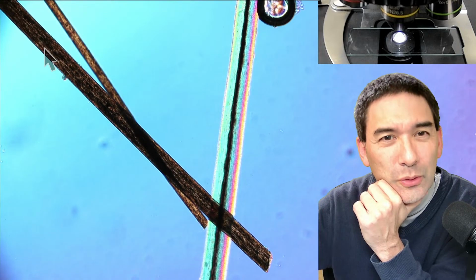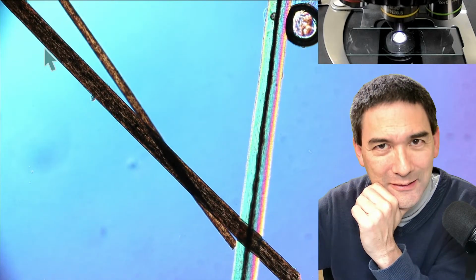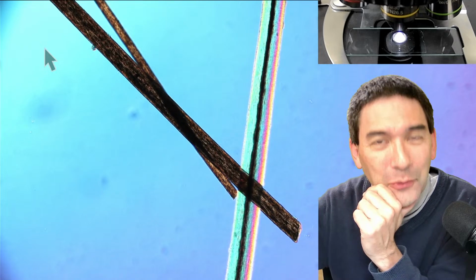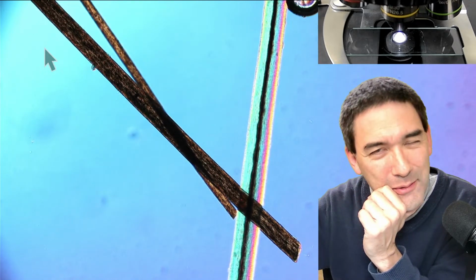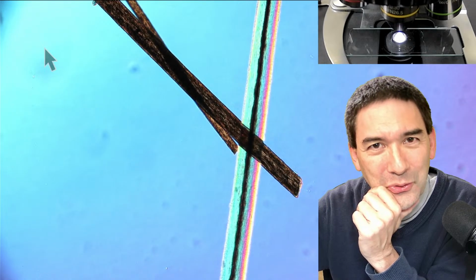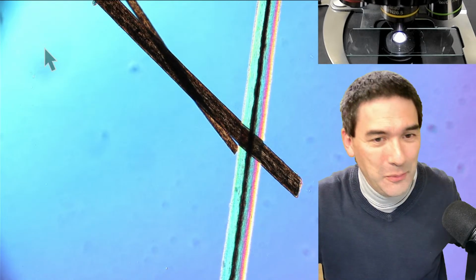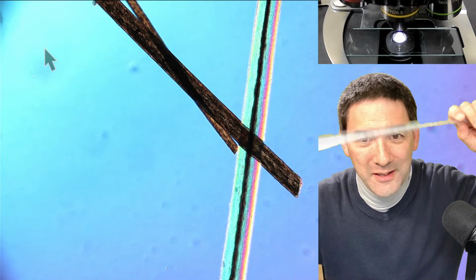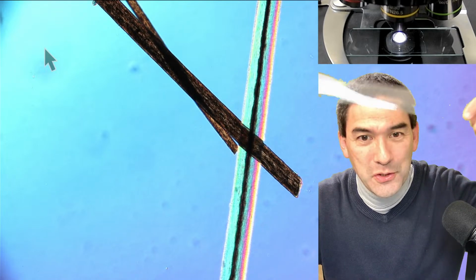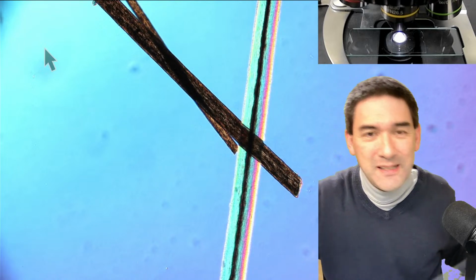There is a little rule that as soon as you start doing a little bit of math, people start clicking away, but don't worry, maybe just a little bit, very little, okay? I want to show you how to do size calculations using a ruler and a microscope. A ruler like this. Yeah, it's possible. I just thought I'm going to show it to you. Okay, but it's really not a lot.